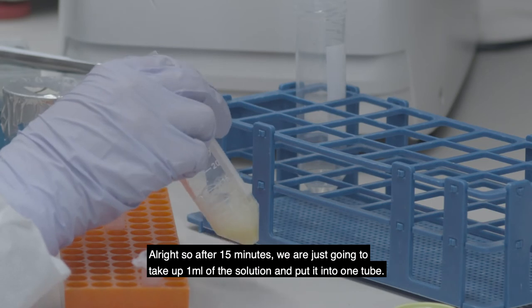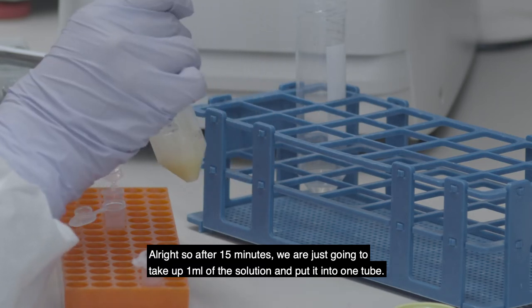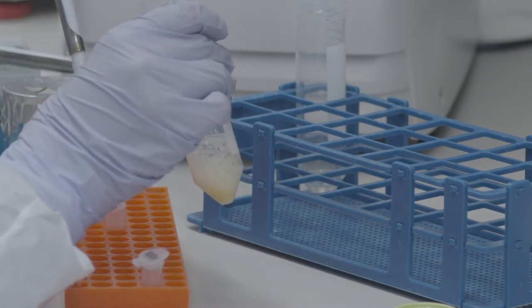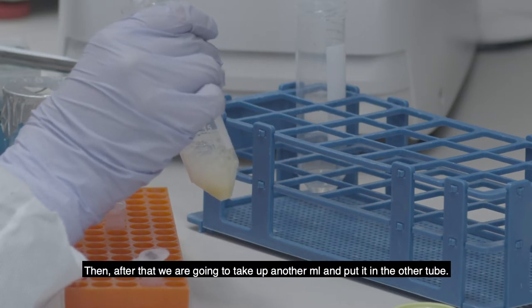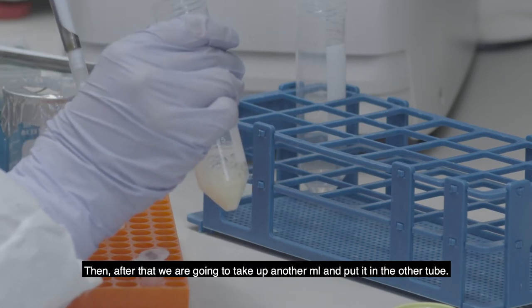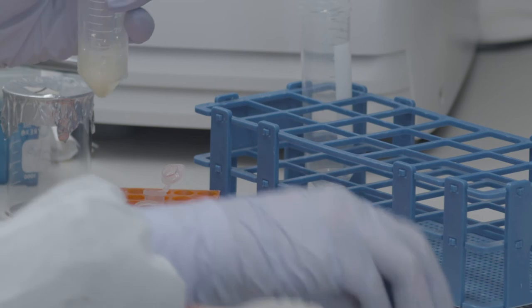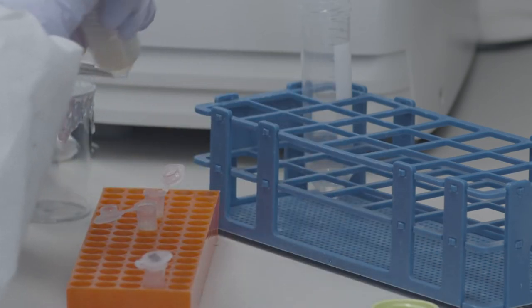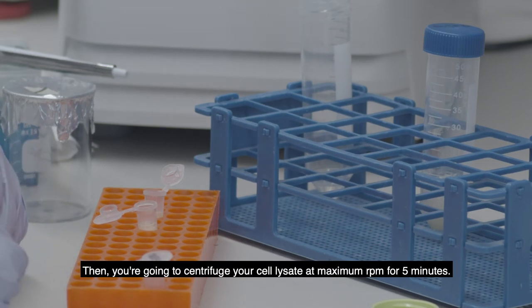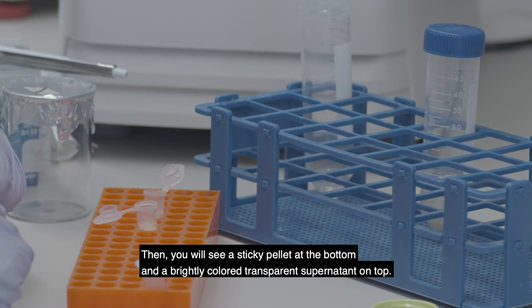After 15 minutes, we're going to take up 1 ml of the solution and put it into one tube, and then take up another ml and put it in the other tube. Then you're going to centrifuge your cell lysate at maximum RPM for 5 minutes. You'll see a sticky pellet at the bottom and a brightly colored transparent supernatant on top.